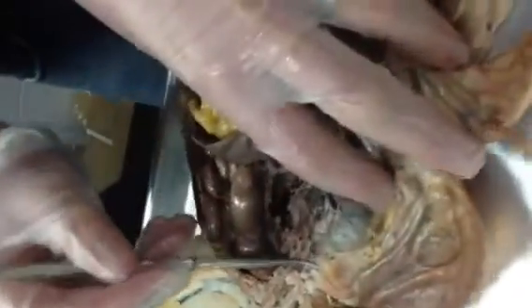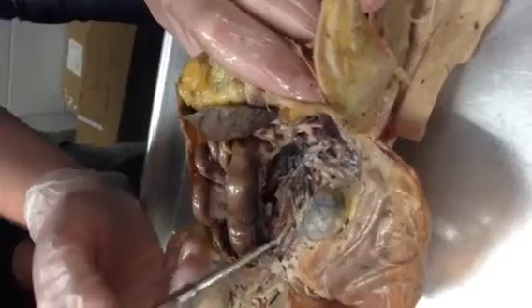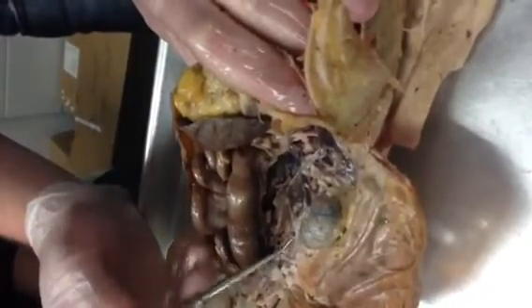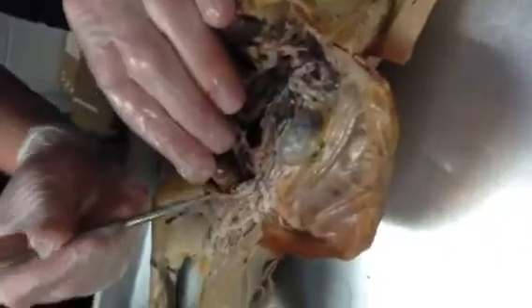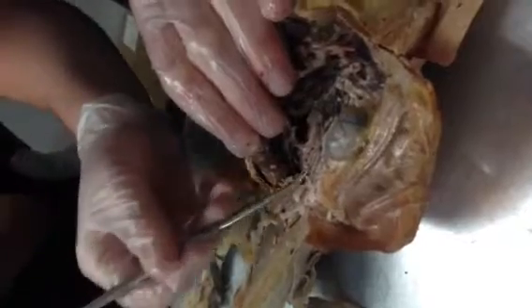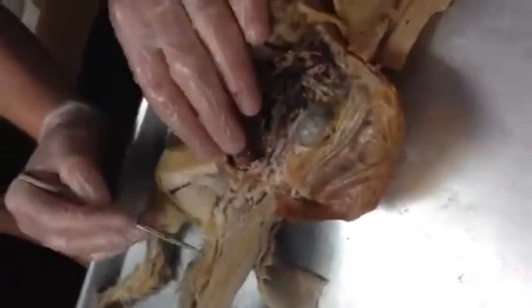So it would be that thin in all of them, even in a female cat? Well, in the female cat, does it need to run all the way down? No. It's going to run right out to the ovary, which will be right here. But in the males, the testes have descended, and so that's pulled all the way down. And so that's going to run all the way into the spermatic cord, which is here, right? So we're getting a little bit ahead. We'll come back to it. But those run down through the inguinal canal into the spermatic cord, and then out to the testes.